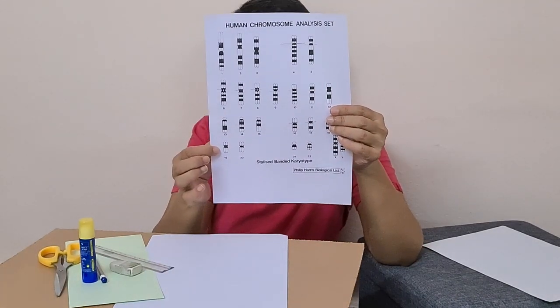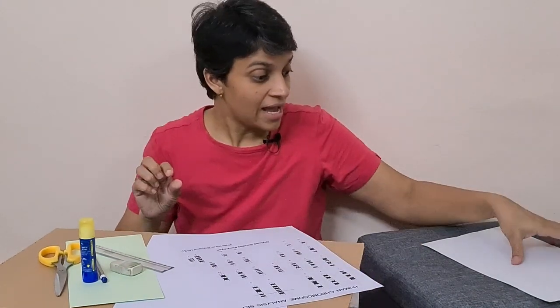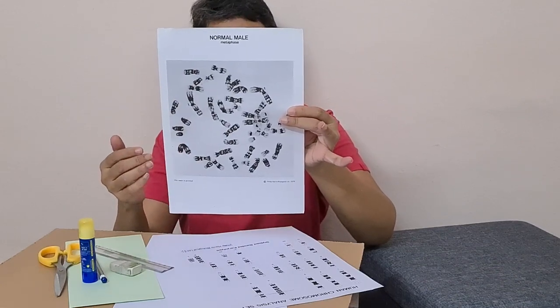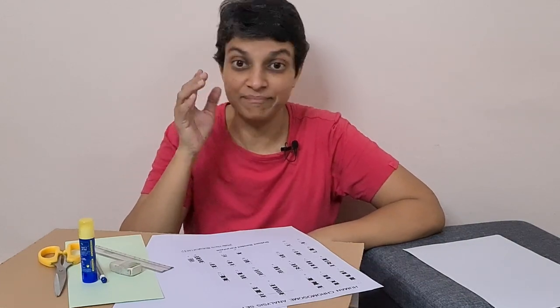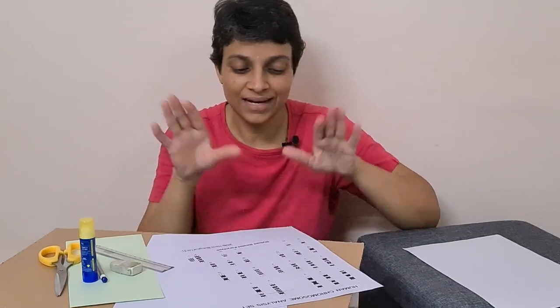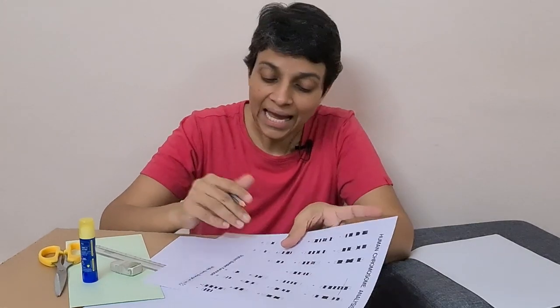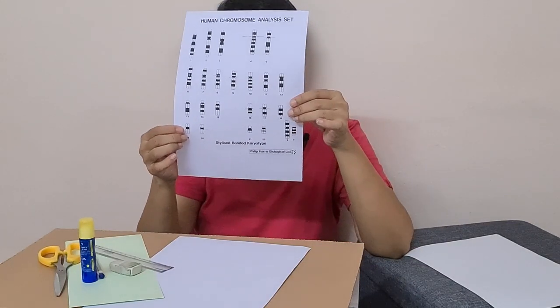Group F has two pairs of small metacentric chromosomes. If you look at the metaphase spread, they will appear as small, evenly shaped butterflies — small butterflies with equal length of wings. F has small metacentric chromosomes where P and Q are of equal length. If you draw a line across the centromere, you will see this clearly.